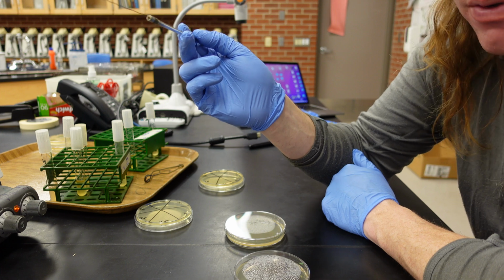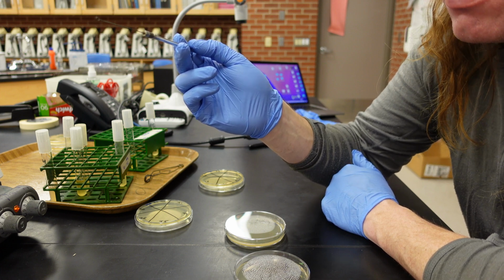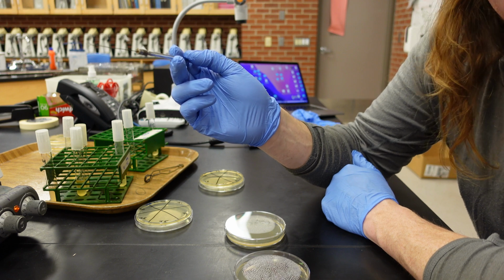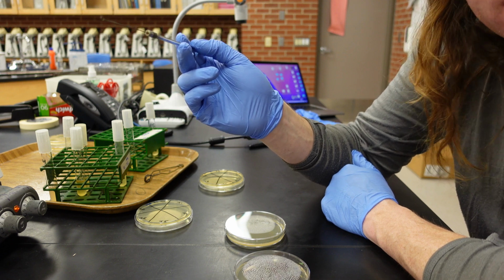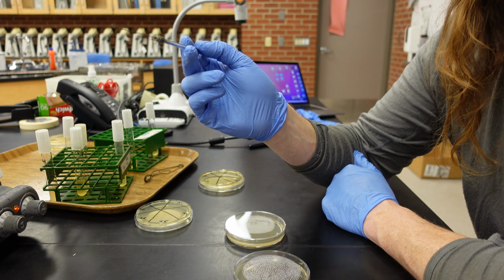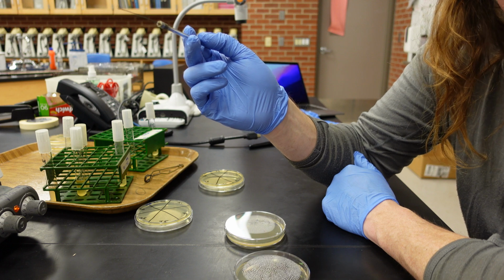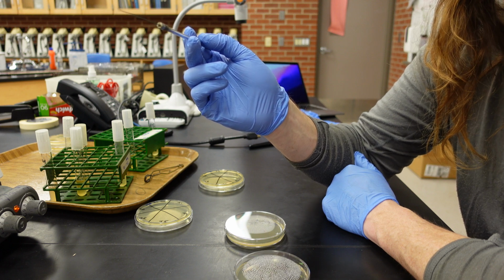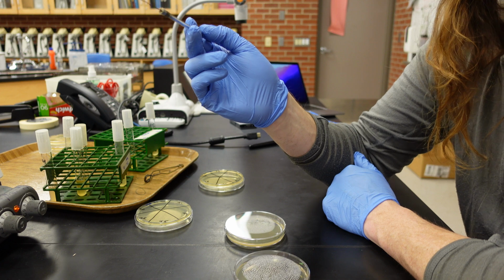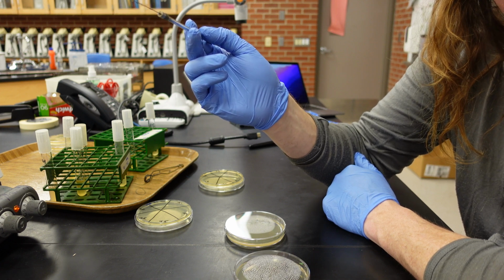You may have observed Serratia marcescens at home if you don't wash or clean your shower curtain very often. That pink color is most likely due to Serratia marcescens. The pigment produced by Serratia offers protection against excessive UV light from the sun, serves as an antibiotic, and it enhances flagella production. It also has cytotoxic qualities.